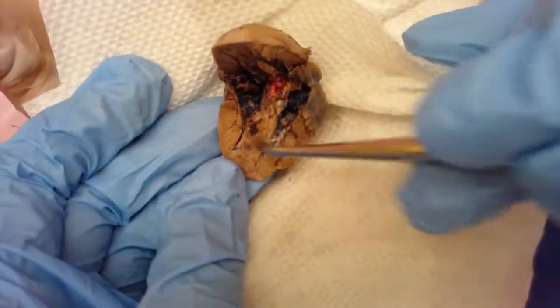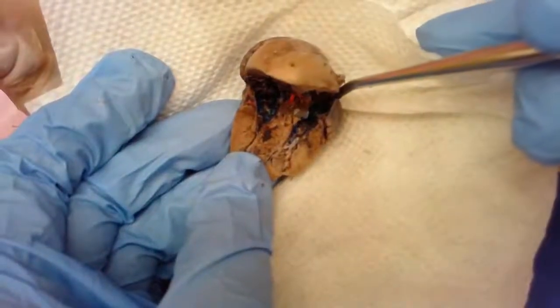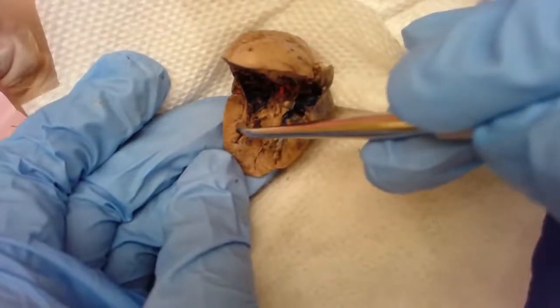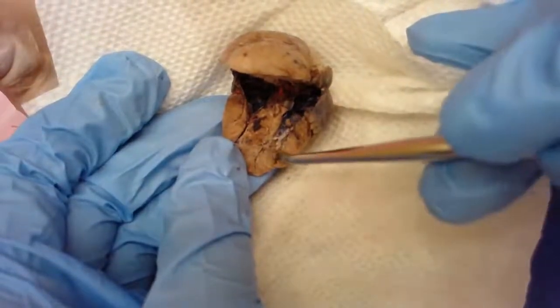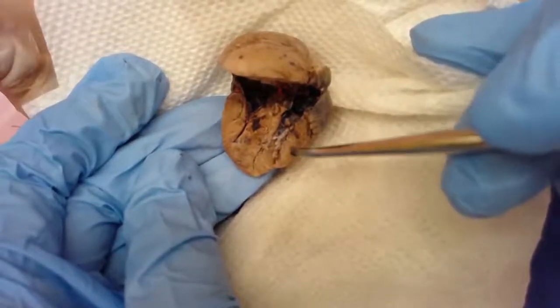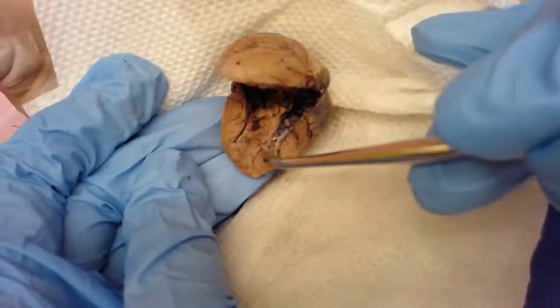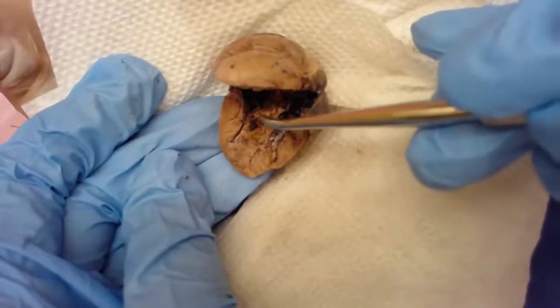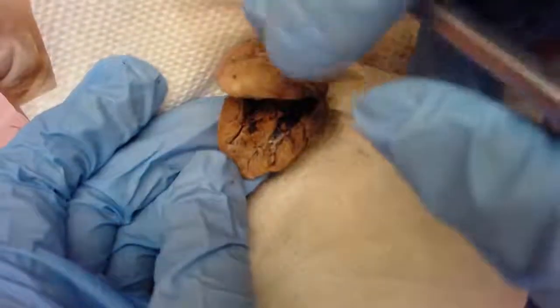Look at the thickness of the wall of this muscle compared to the thickness of the wall of those atria. These are much thinner because the atria are receiving chambers, and the ventricles are actually pumping chambers. They have to be able to pump blood from the right ventricle going to the lungs, and from the left ventricle to the rest of the body. You can actually also tell that the left ventricle muscle surrounding it is actually thicker than the right ventricle, because think about how far the heart has to pump blood to get to the rest of the body versus the right ventricle just sending blood to the lungs, which is a little bit closer. So that's the internal structure of the heart.